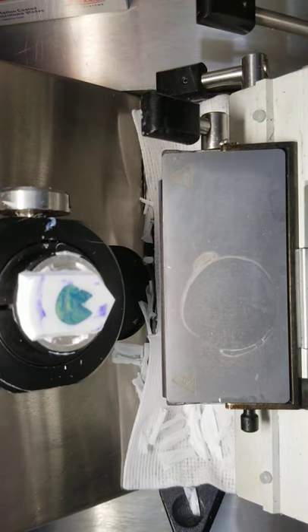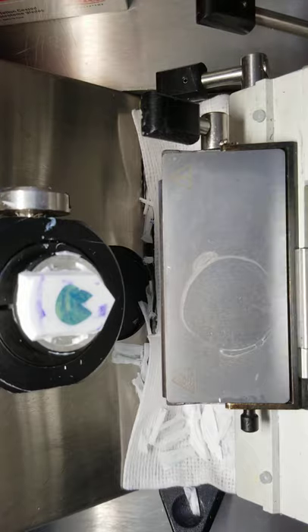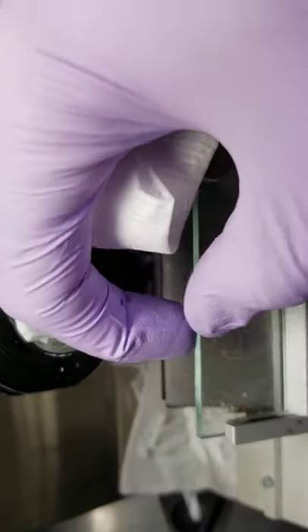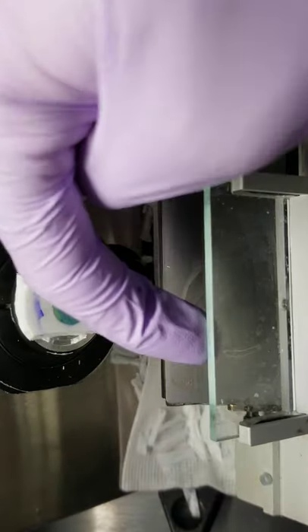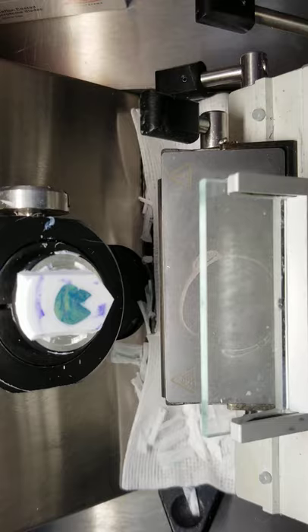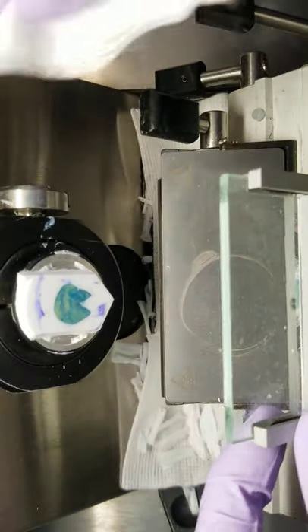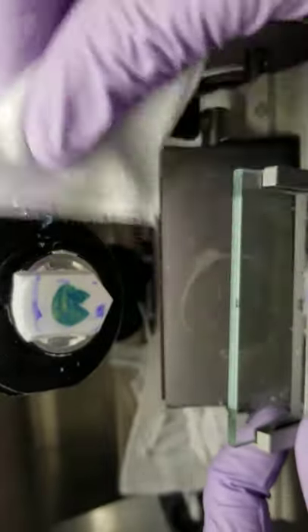Okay, so basics of an anti-roll plate. You always want to check this edge here. Make sure you don't have any buildup, because sometimes OCT can get stuck on that bottom edge. What I always do is keep a piece of gauze in the machine and occasionally, in between sections, just pinch along the edge and wipe it clean. It's all sorts of dusty.